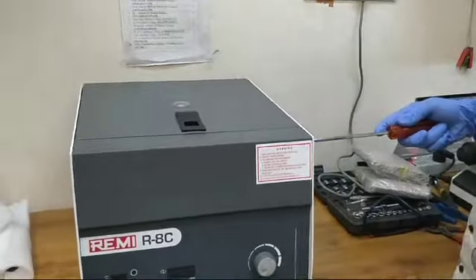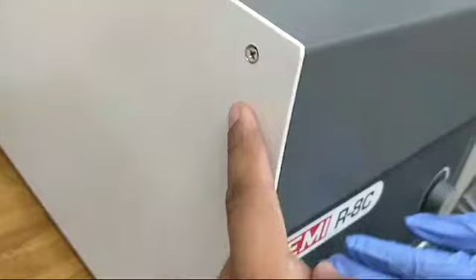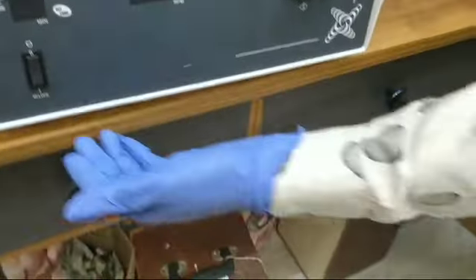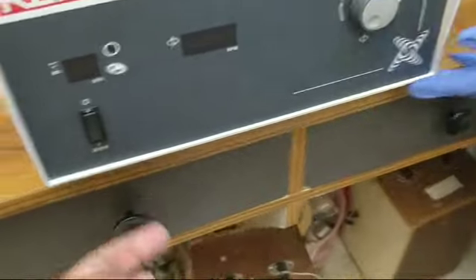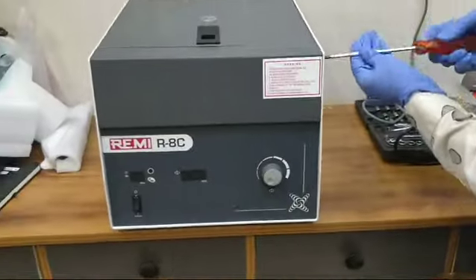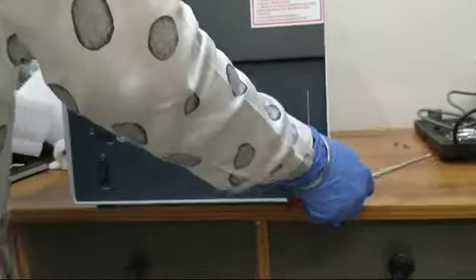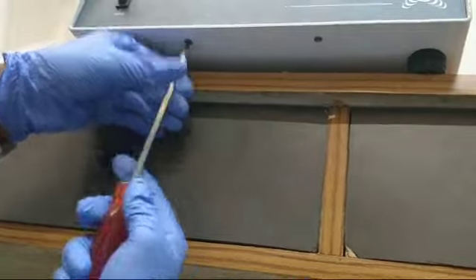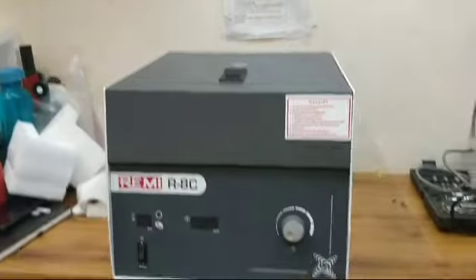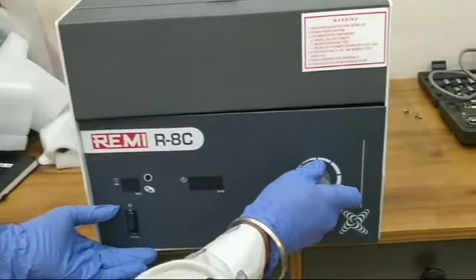Today we are teaching you how to change the carbon brushes. We are removing the screws: one screw will be there, two screws will be there, three screws will be there, in the bottom four screws will be there, here the fifth screw and sixth screw. In total, we will remove six screws. After removing all the screws, just push it.